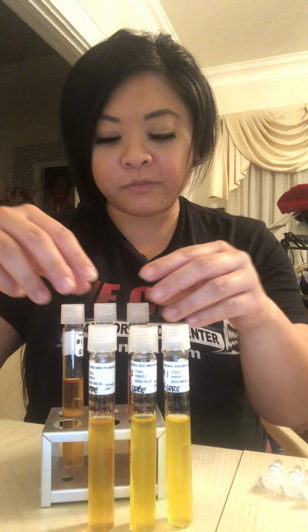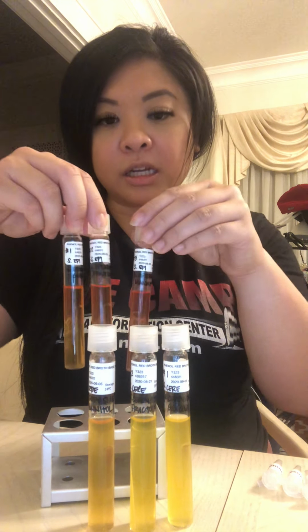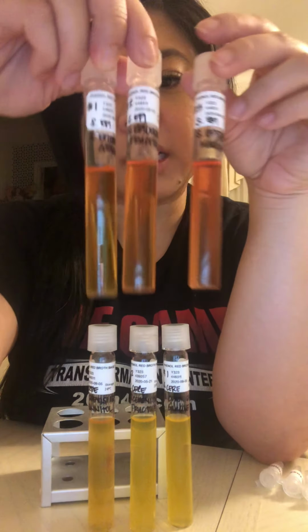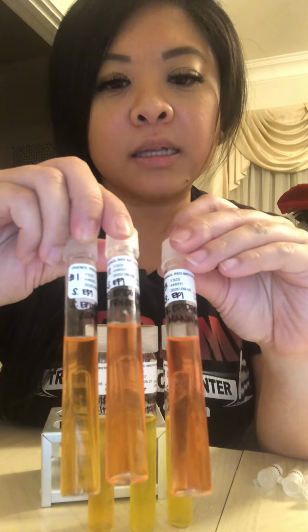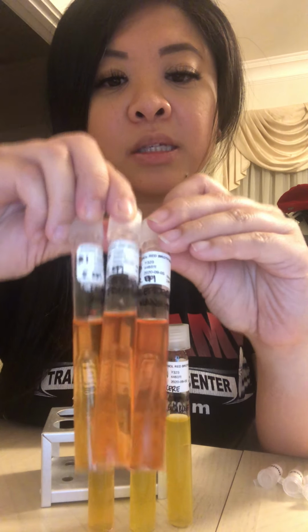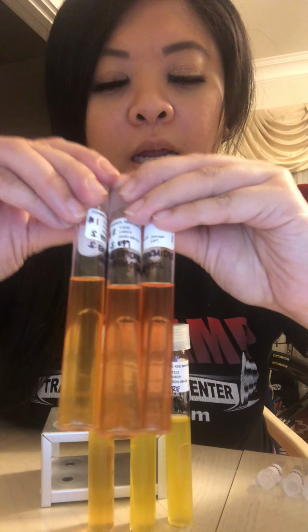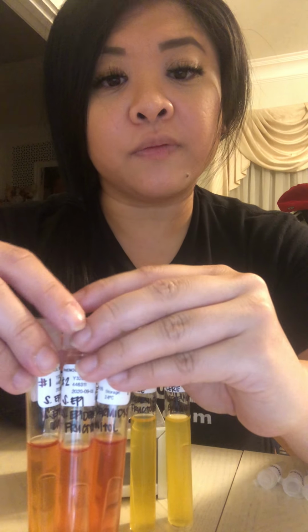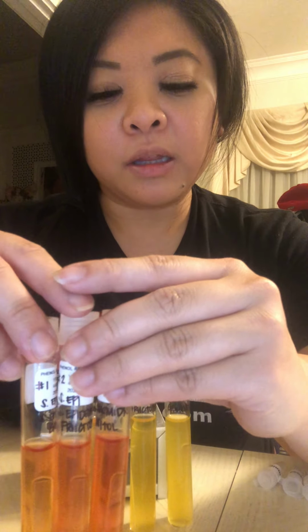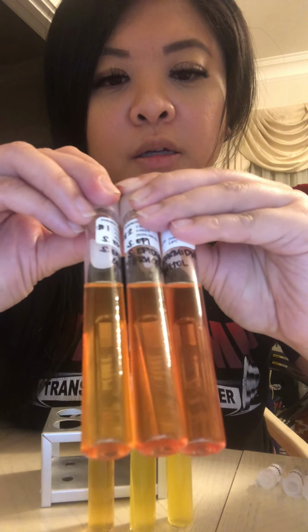So next we have my S. epidermidis, and I found it interesting that the phenol red broth is not the same as it originally was prior to this experiment. It's so much lighter in color. I'm not sure if you could tell from my camera and lighting. And I do understand that the oxidation of sugars occur, but I feel like these are more orange than red.